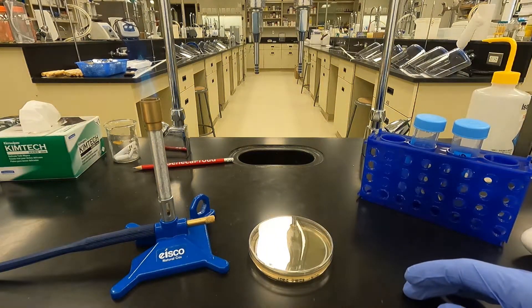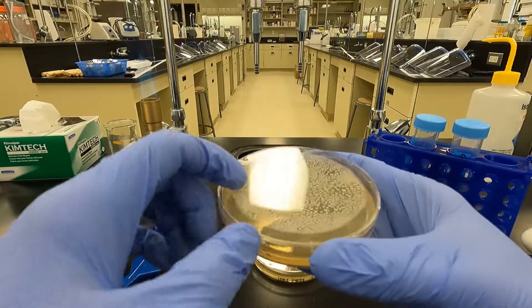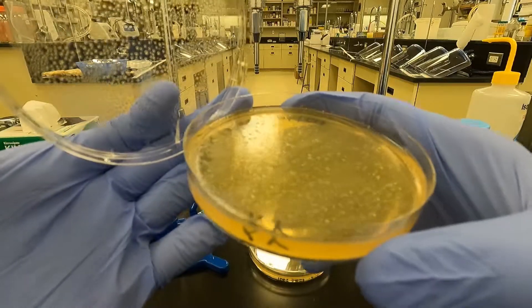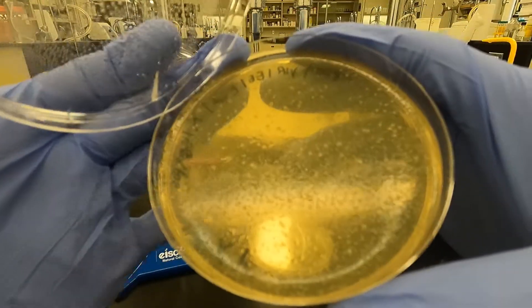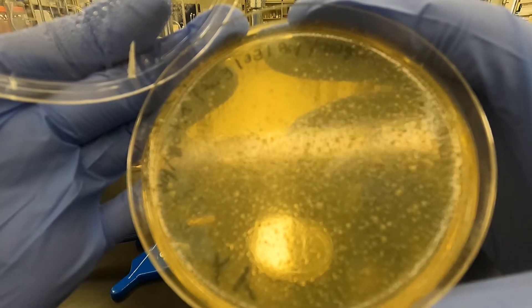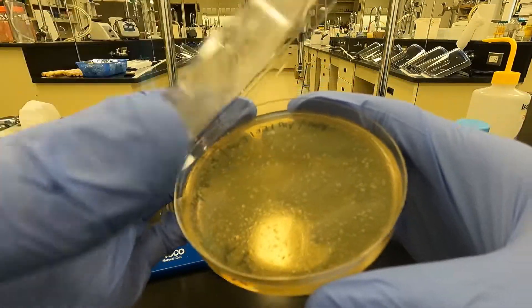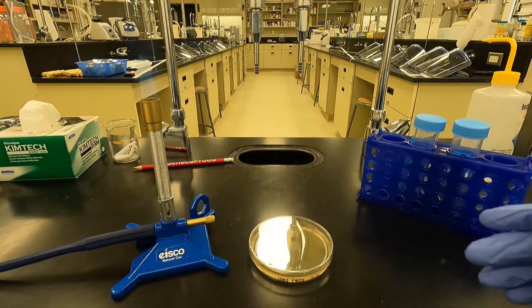The entire top layer is clear of E. coli. That plate was incubated about 6 hours; this one's overnight. You can see that some of the E. coli has been resistant to the phage and they've grown into colonies. That's okay because they're all going to get lysed anyway.